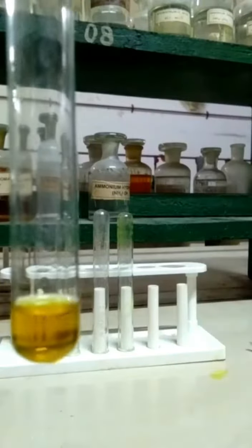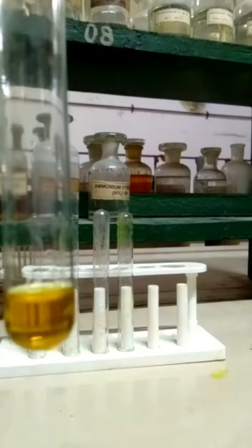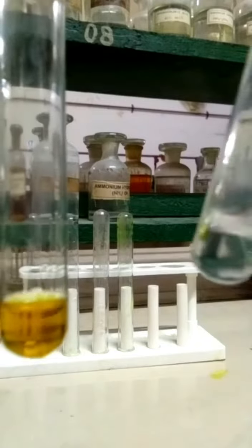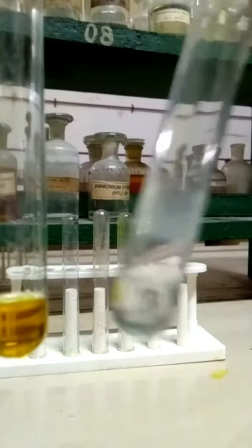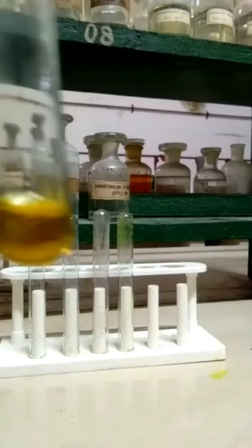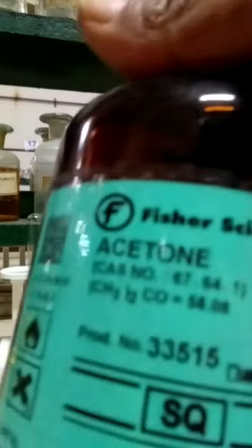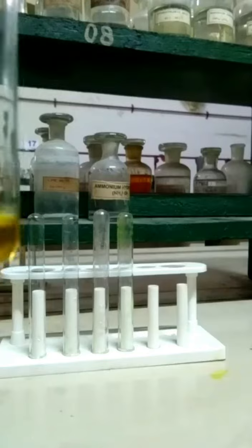Now let us see what happens when excess acetone is added to the DNP reagent. Here is the sample of organic compound, which is acetone. I am adding acetone into the DNP reagent.